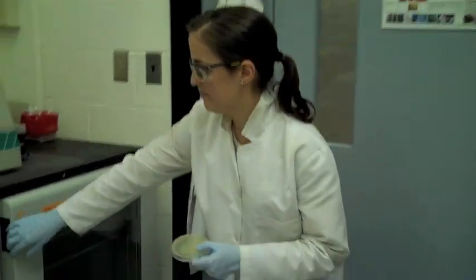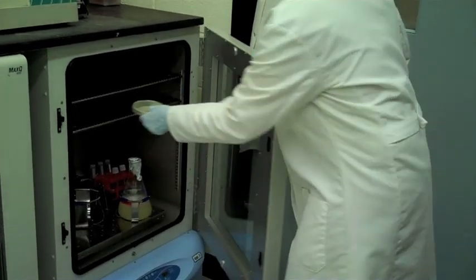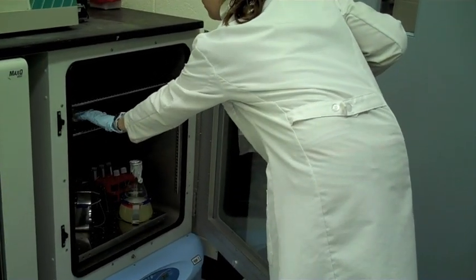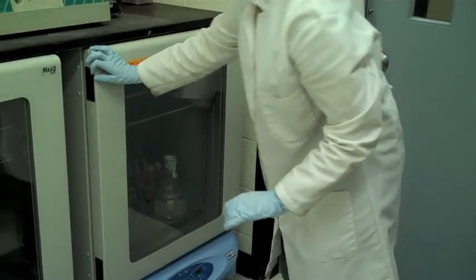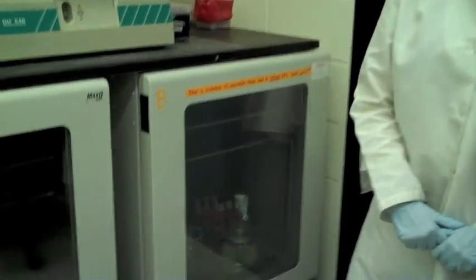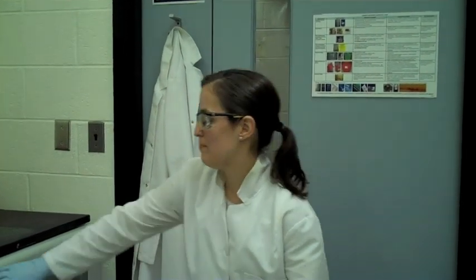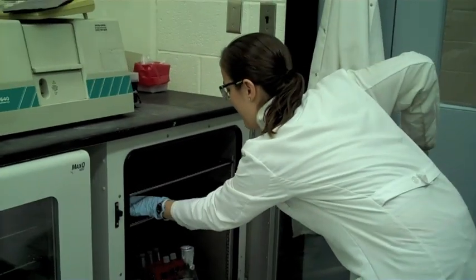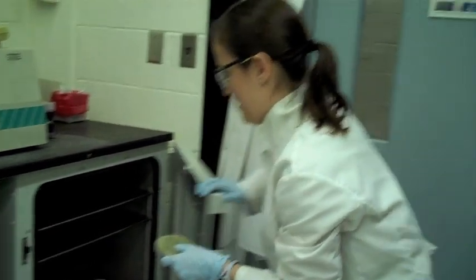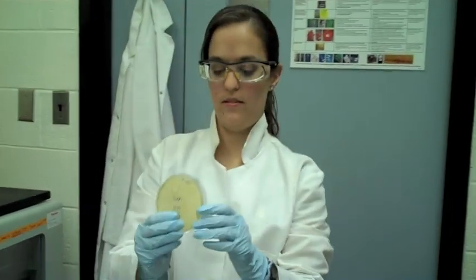Here's our incubator. This is a little bit warm. Now it's going to grow overnight to produce colonies. So it's been a day. Let's check on our bacterial transformation. As I expected, you do have colonies.